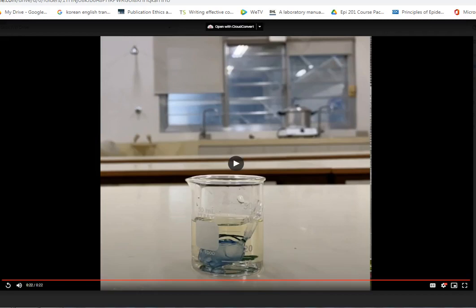If you compare now the size of the starch molecule to the potassium iodide molecule, which one is larger and which one is smaller? So with that, can you tell me the relationship of the molecular size to the rate of diffusion, or in this case, the ability to undergo diffusion?